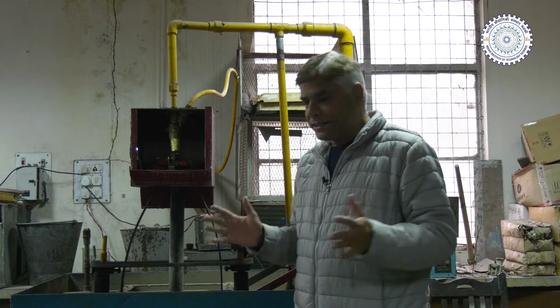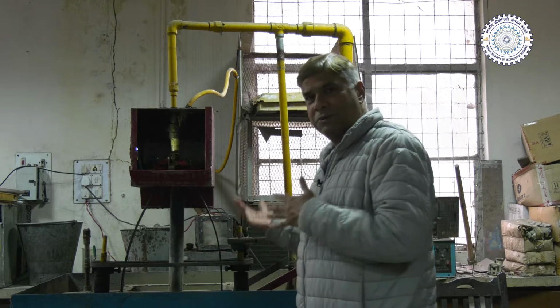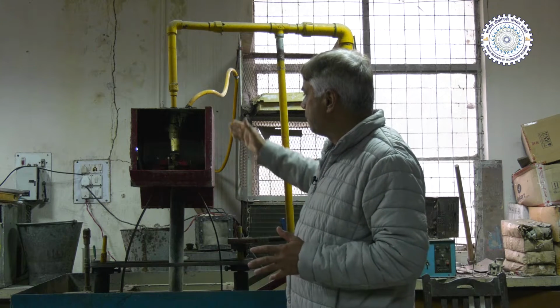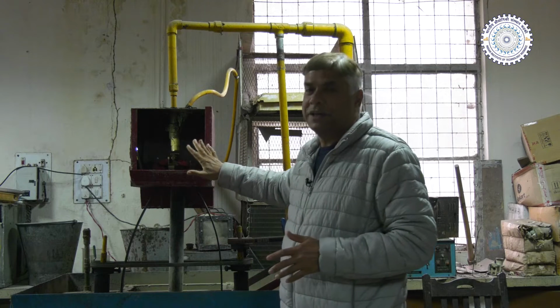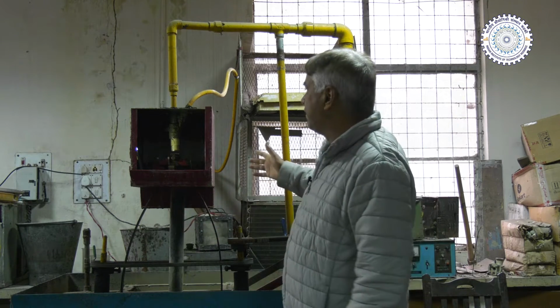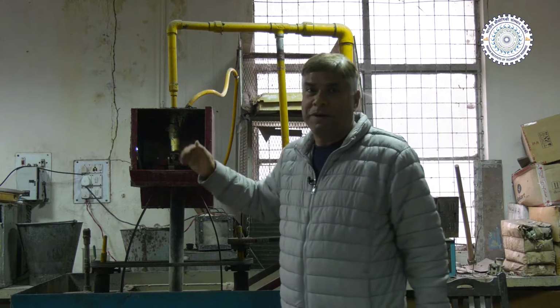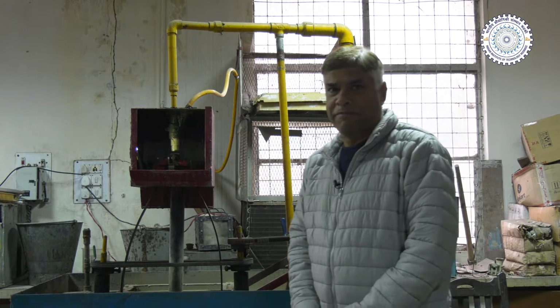Since in this case the slurry is a fluid, we will show you the slurry also. When it is circulated, a jet at very high velocity will come out from the nozzle, and then it will be directed over the surface. We have to close this, so we cannot see how the test is actually happening, but this is the kind of setup which is used, and we will try to show how the jet comes out and then the test is performed.